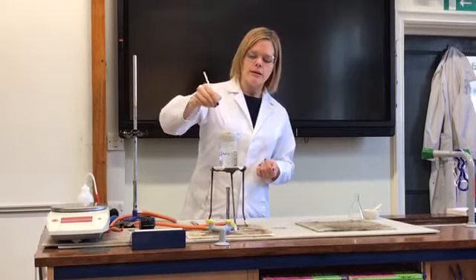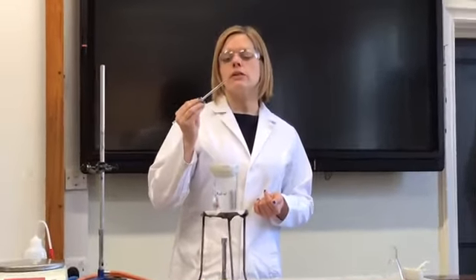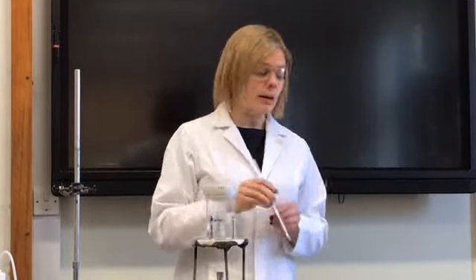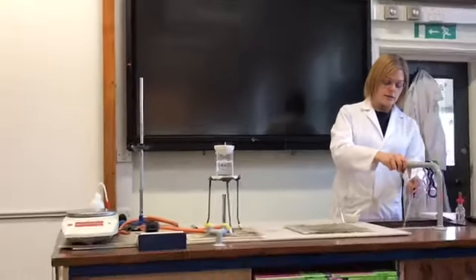I'm going to dip it in, give it a little shake, and look at the edge of this glass rod and see if any little crystals form. There are no crystals forming just yet, so I'm going to leave that to heat up for a bit longer, and I shall keep testing this.